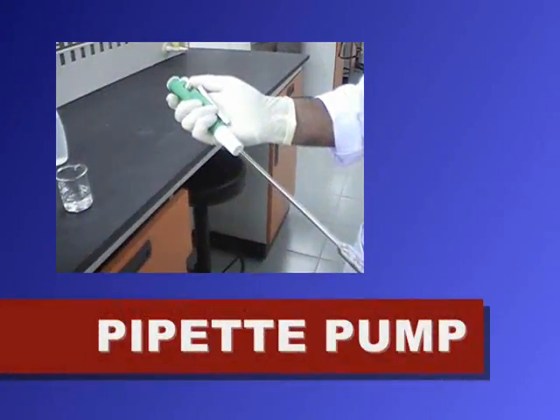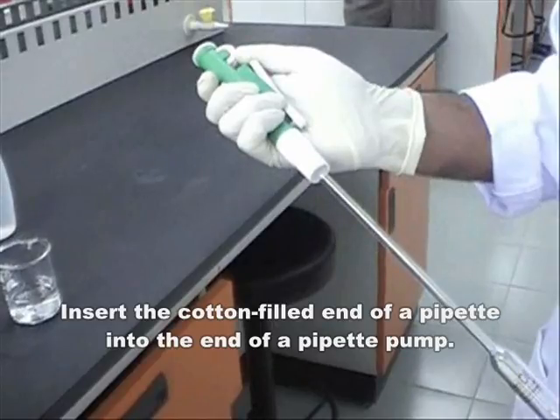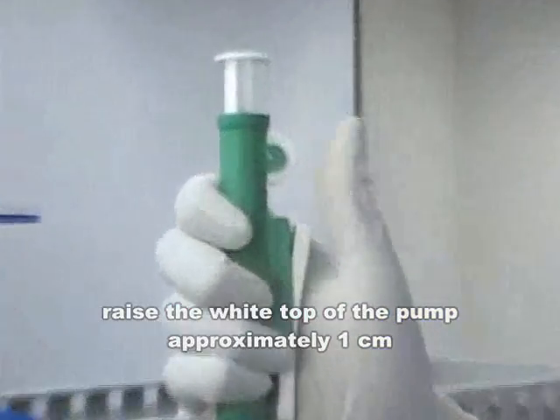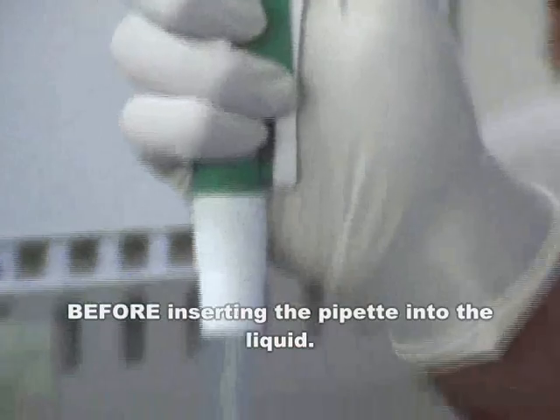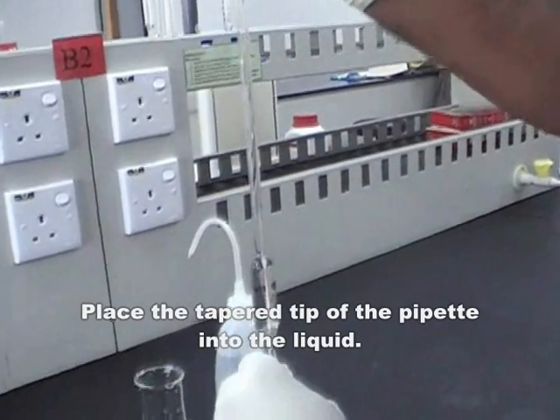If you are using a pipette pump, firstly, insert the cotton-filled end of a pipette into the end of a pipette pump. Using the wheel at the top of the pump, raise the white top of the pump approximately 1 cm before inserting the pipette into the liquid. Place the tapered tip of the pipette into the liquid.